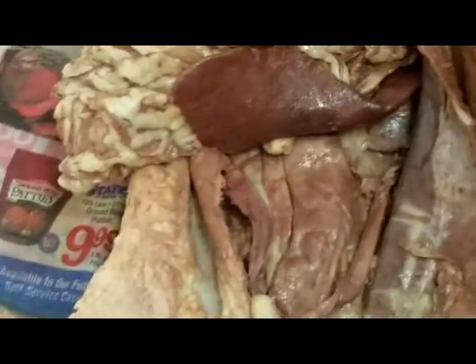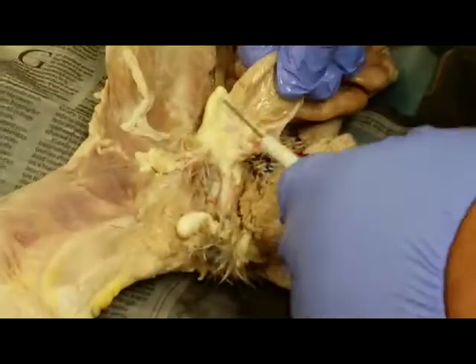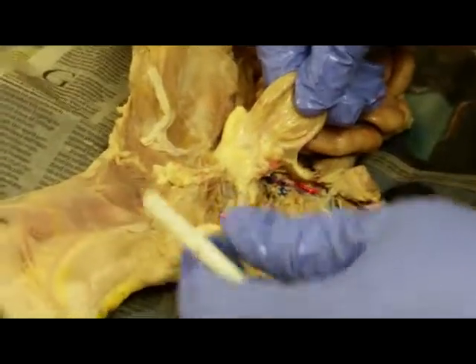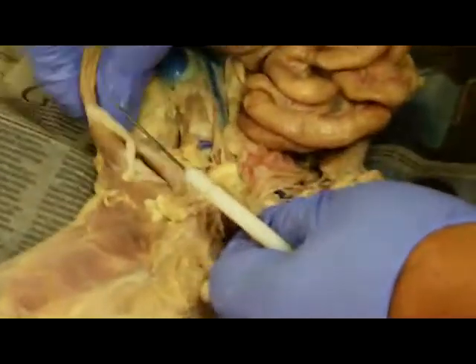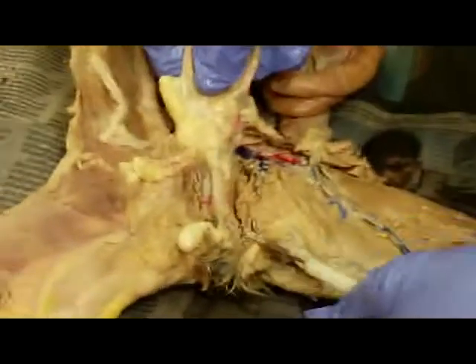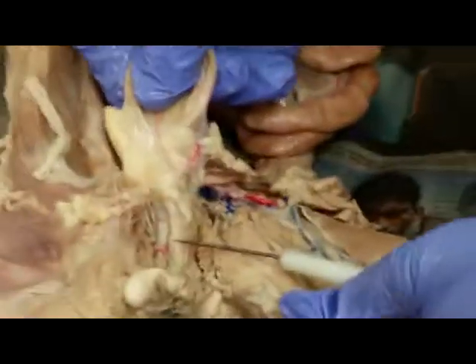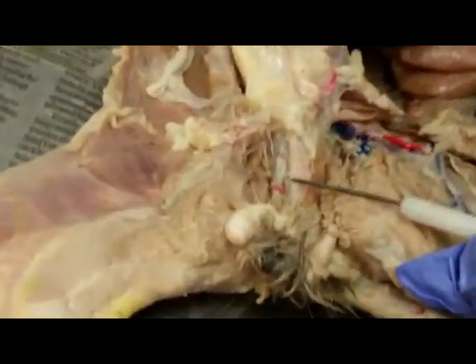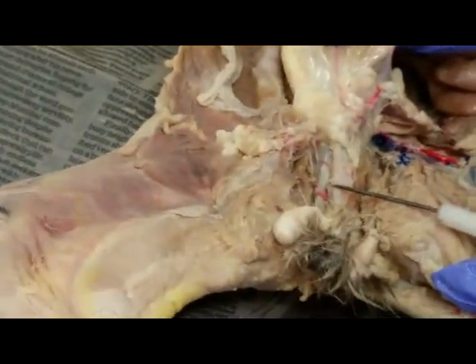So that's the female. Now let's look at what? On either side of the urinary bladder, one was cut. Let's get the word. Seminal vesicle. They have the same thing, seminal vesicle. And this is again the ureter entering into the urinary bladder. And watch very carefully now. You look at your picture. This is the urethra, and the urethra passes right through here where there's a little bulb. What does this bulb represent? Look at the picture that I gave you.